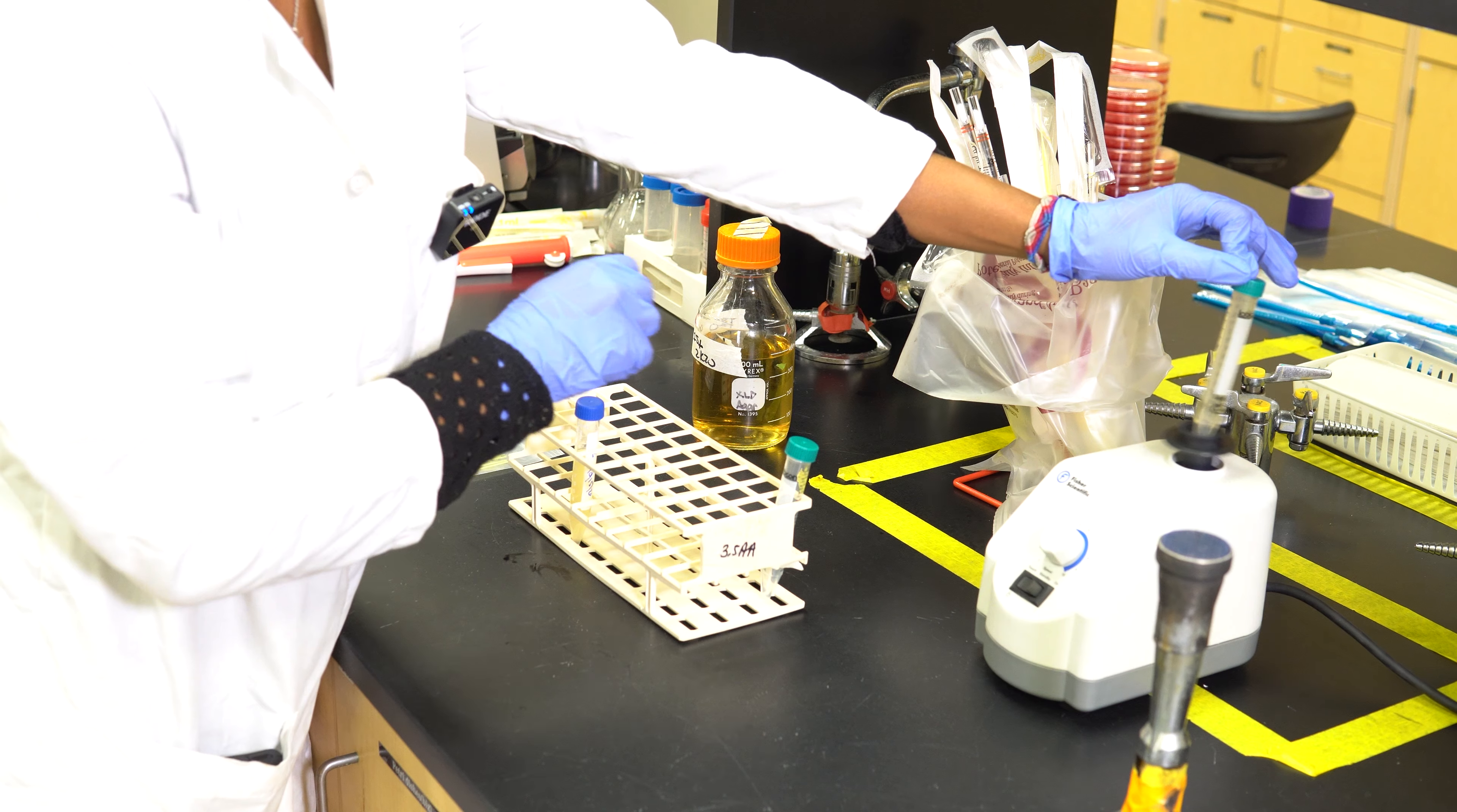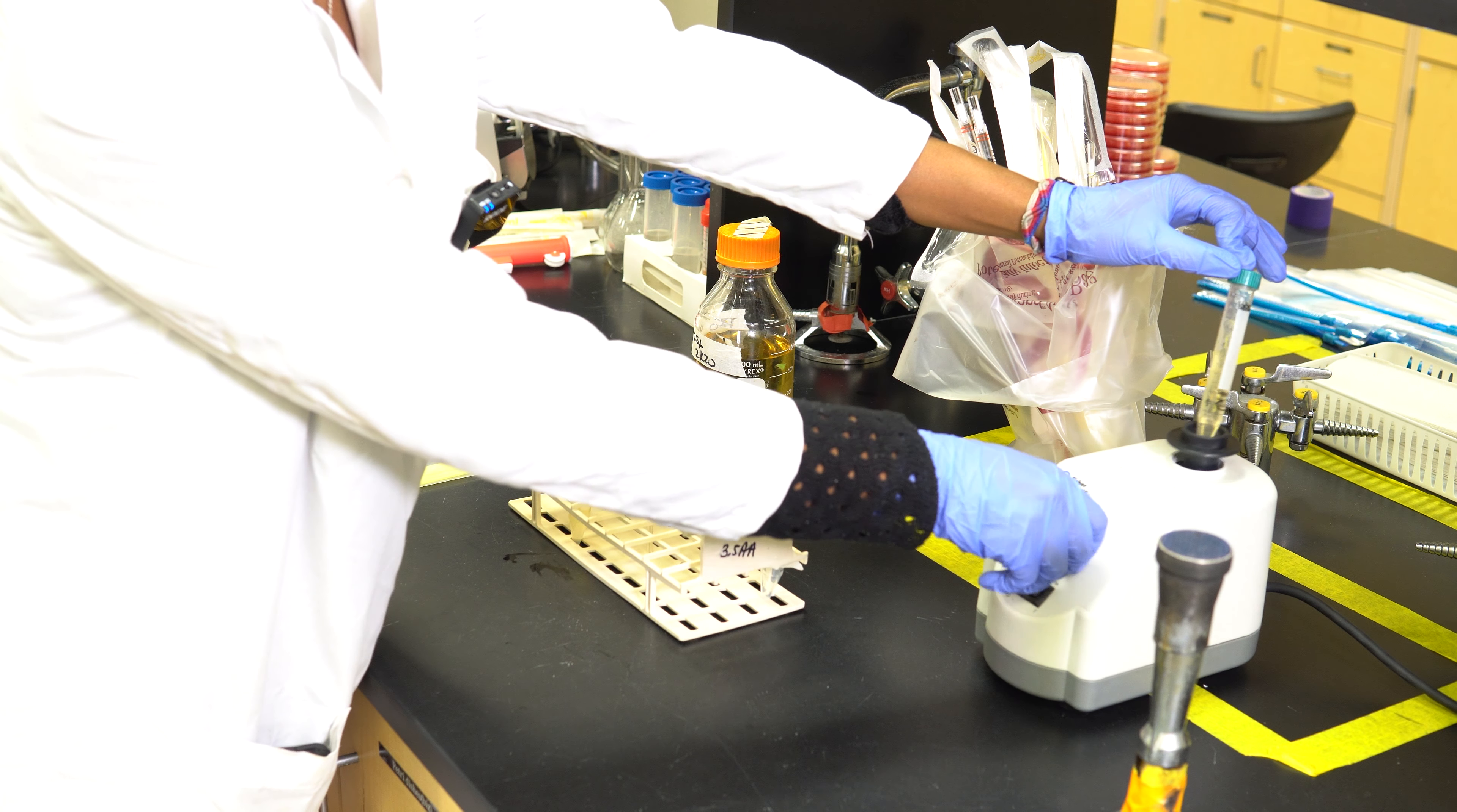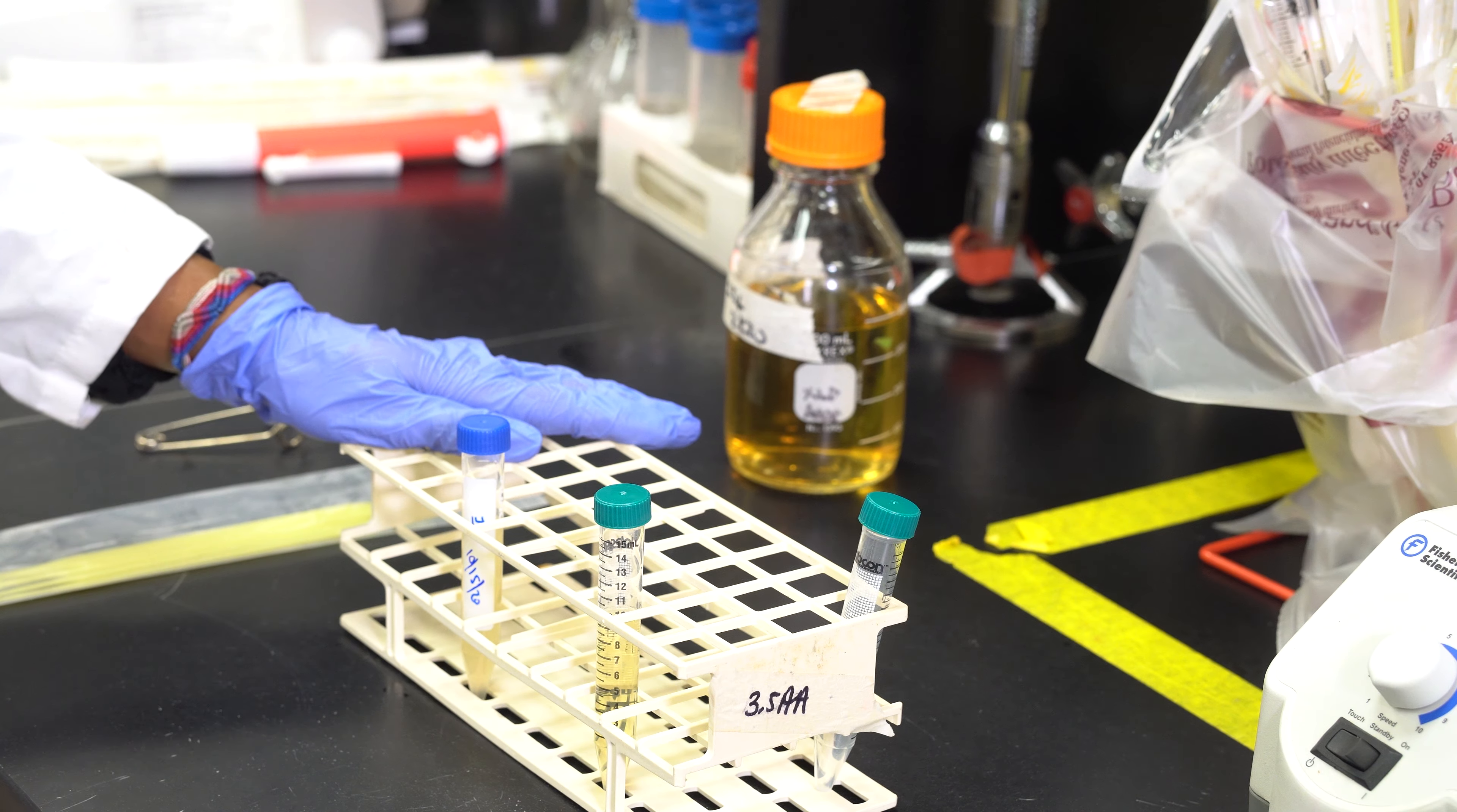Next, you're going to grab a disposable loop and place it inside of the microorganism, and you're going to transfer it to the fresh TSB.